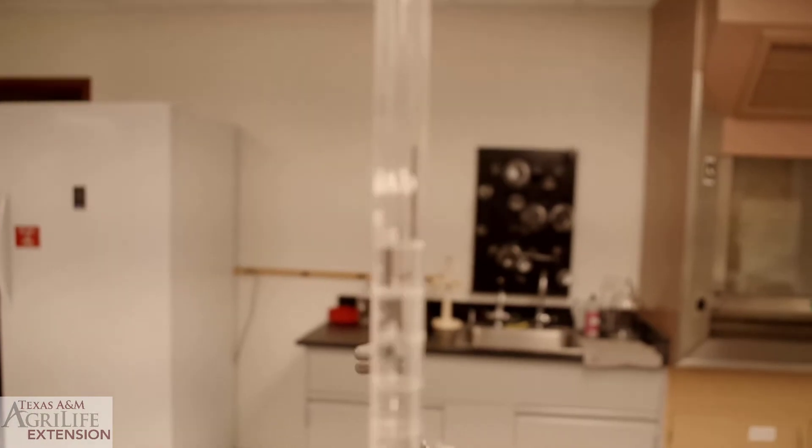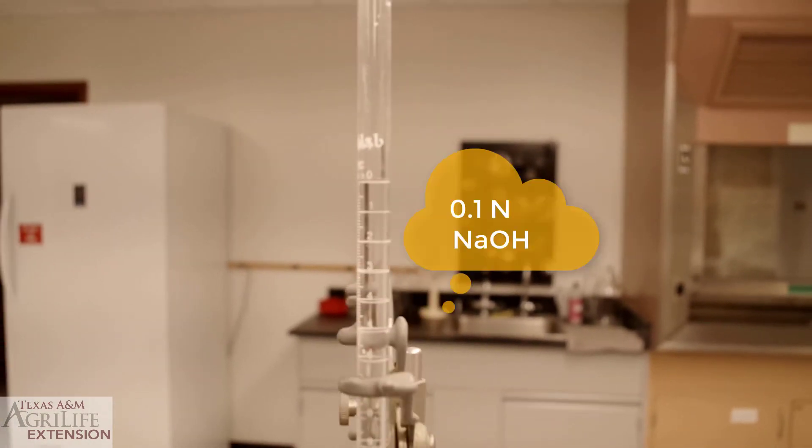We are titrating an acid, so we will use a base, in our case 0.1 normal sodium hydroxide, for our titration.